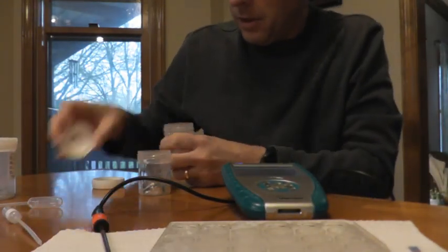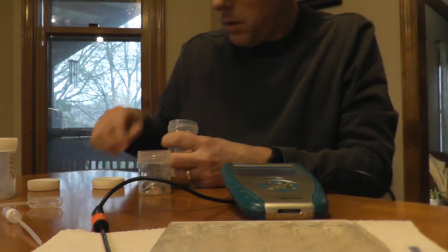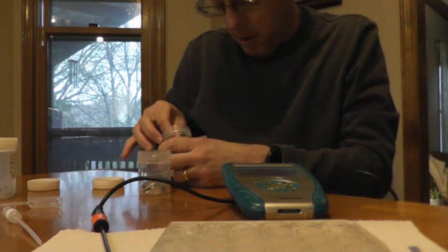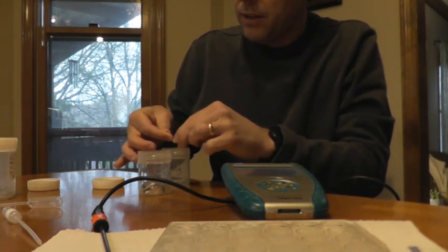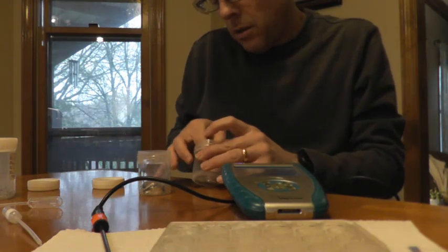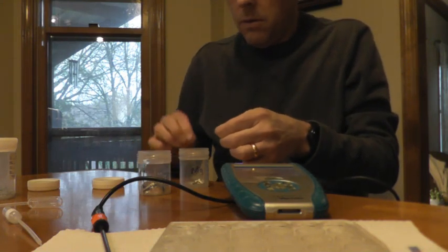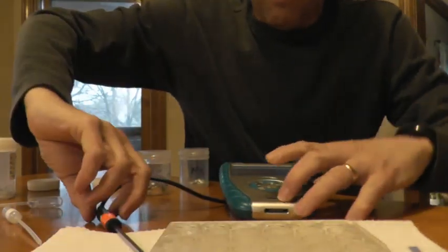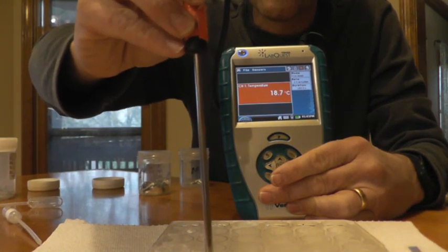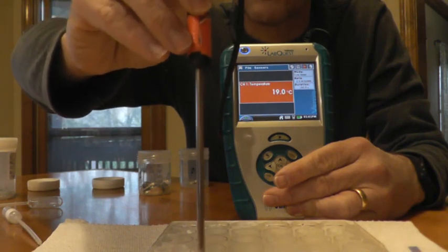All right. So throw a piece of magnesium in there. It'd be nice if these were all the same mass, but they're not going to be the same mass. Because obviously something that takes up more mass is going to cause a bigger reaction. But there we go. That's a good one. Drop that in there. Put the temperature probe in here. And from where I'm sitting, I can hear it bubbling already. So our magnesium is reacting with our hydrochloric acid.